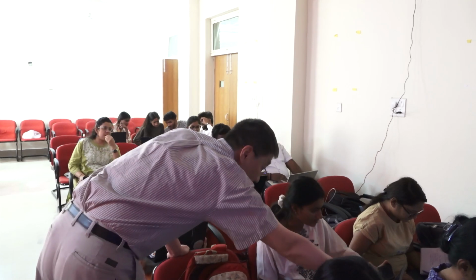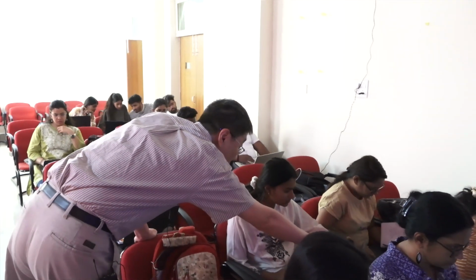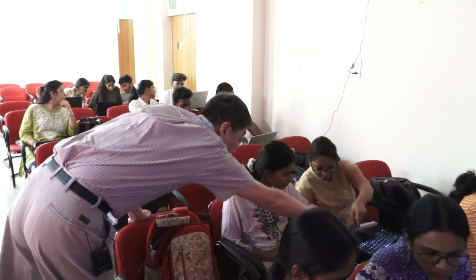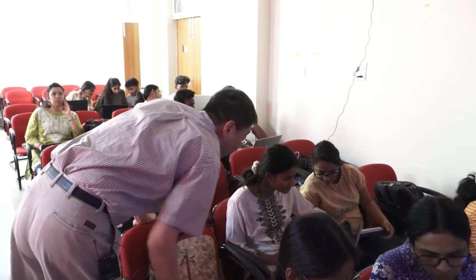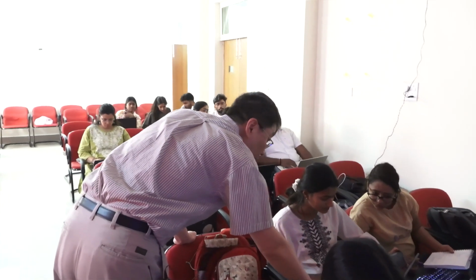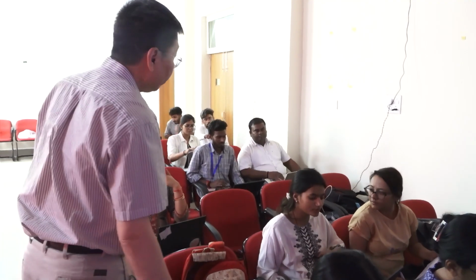Okay. Go to Edit. No, Draw. You have Draw, right there. Which version? Oh, you're using 1.1. I'm sorry, I don't know how to use 1.1. I see, you're using a different version of Coot. We are using 0.9, so it's a different version. So you have to somehow center on valine 2.